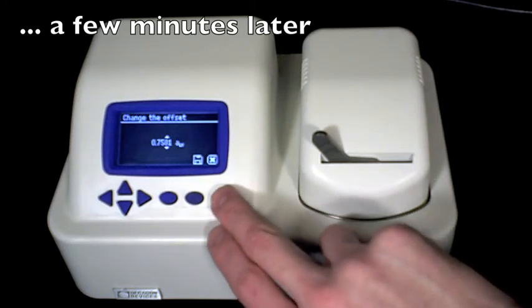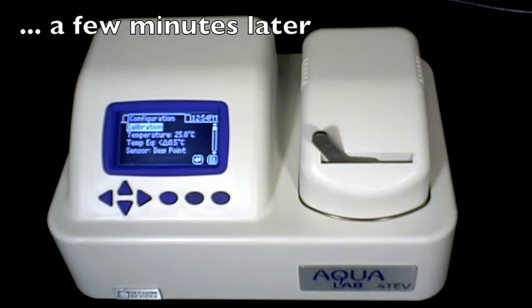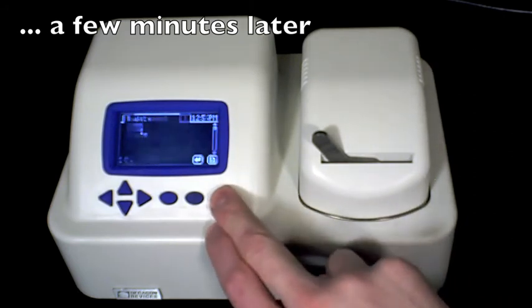Simply hit the X button and return to the measurement screen, and begin making water activity readings on your product.